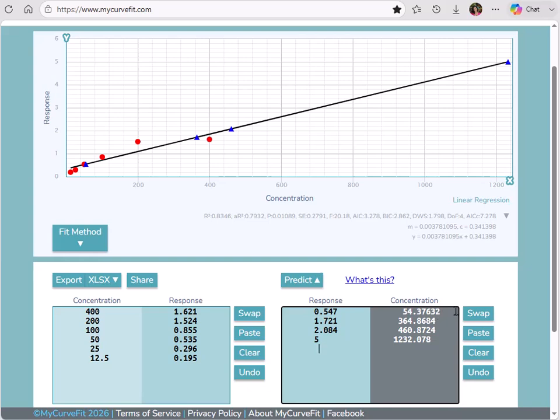Linear regression is not generally suitable for sigmoidal dose-response curves because these data are intrinsically nonlinear. Responses typically have a lower plateau, a steep concentration-dependent transition region, and an upper plateau caused by biological or assay saturation. And as we can see, the linear regression will extrapolate unrealistically beyond the observed data, because a line continues indefinitely, whereas real biological responses approach limits. Therefore, linear regression may only be defensible over a predefined, valid linear working range. For full sigmoidal dose-response analysis, a 4PL or 5PL nonlinear regression model is more appropriate.